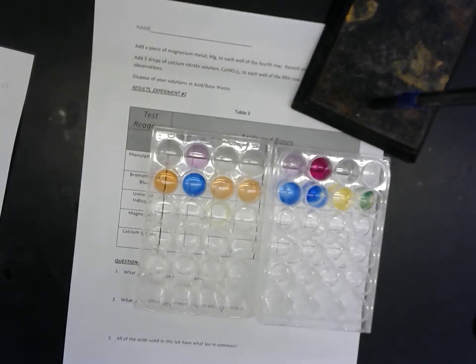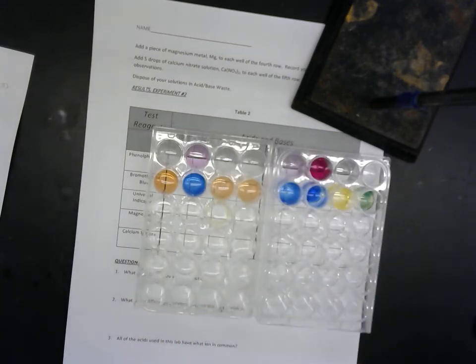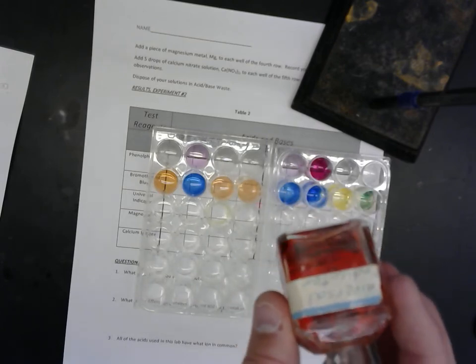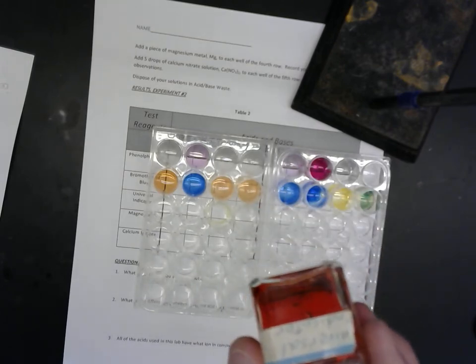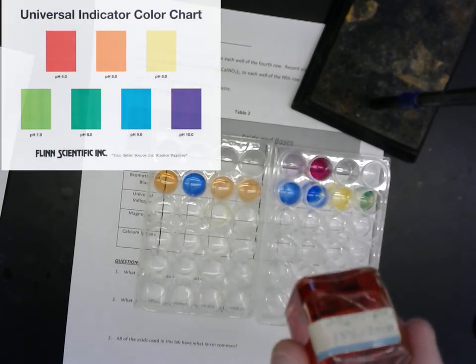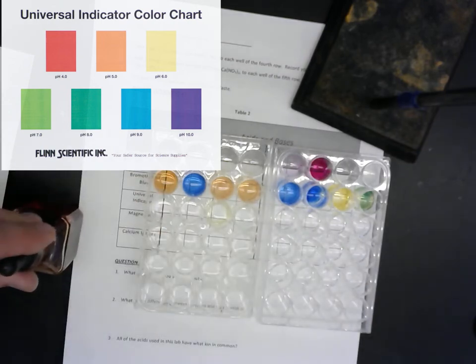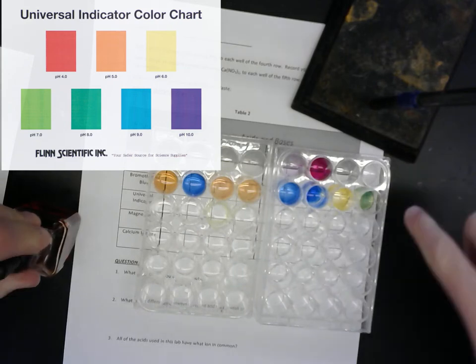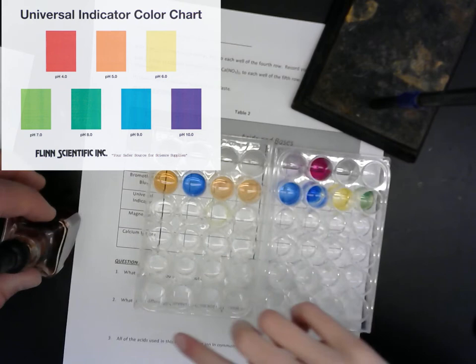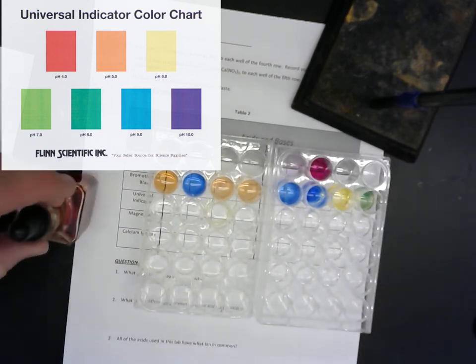All right. Next we have what's called a universal indicator. Universal indicator is just a mixture of several different color indicators. And I'll be sure to provide a picture reference for you about what the colors mean. Daddy, can I make an observation? Yes, please do. So when it was clear, this was clear, and when it was green, this was green. So is this one going to be red on that line? That's a good question. Let's find out.